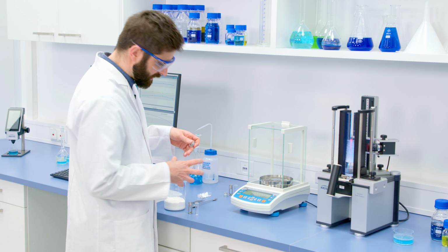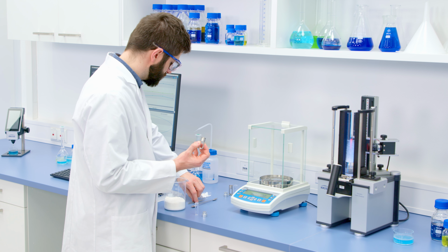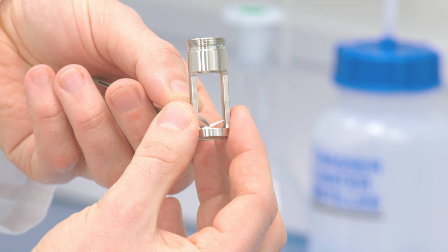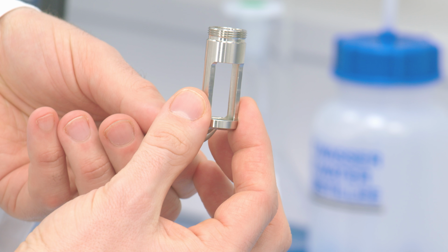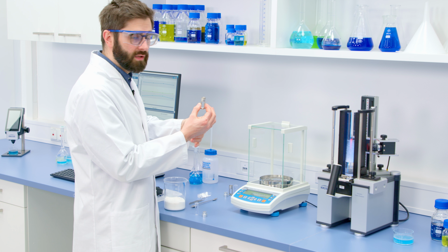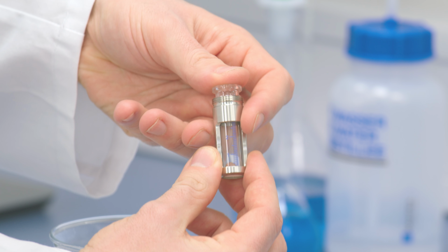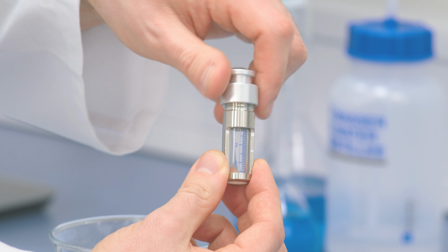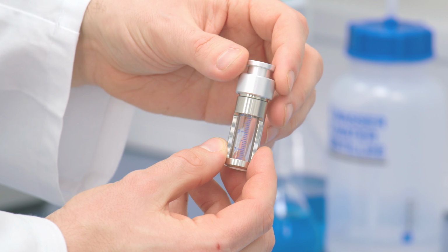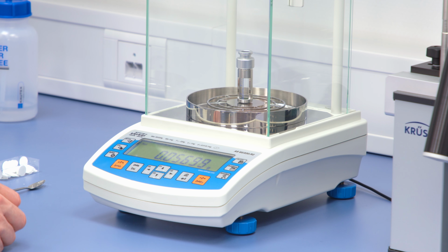In order to prepare my microcrystalline cellulose for the measurement, I first need to take this metal part of the Washburn set, and I can add from here one of these filter papers into the bottom. Now what this does, it allows the powder to stay inside the Washburn cell without falling out, but still lets my liquid rise up into the powder. Put my glass tube on top, where the powder will be held, and I can screw the cap on. Now I want to put it onto my balance here, which I can then tare.